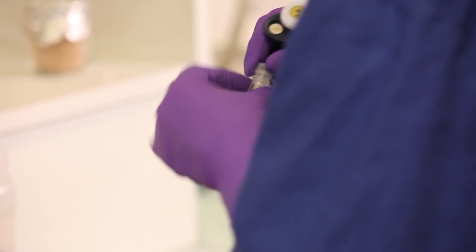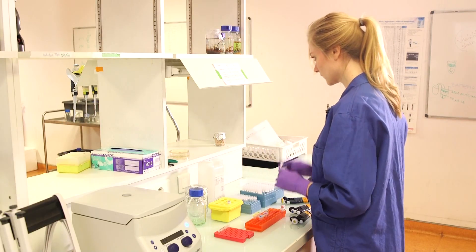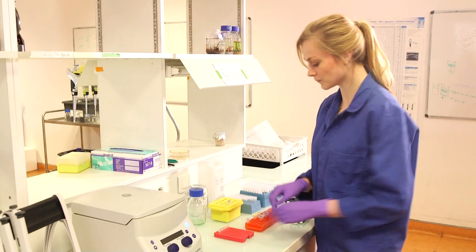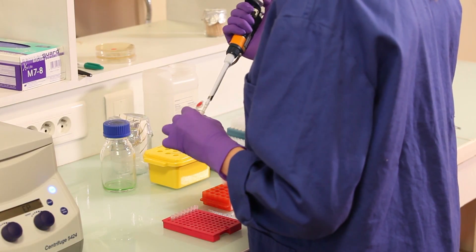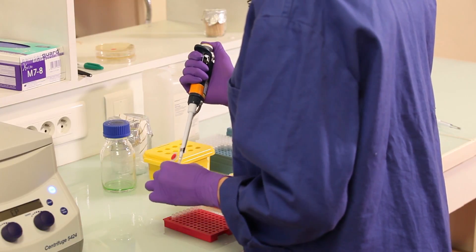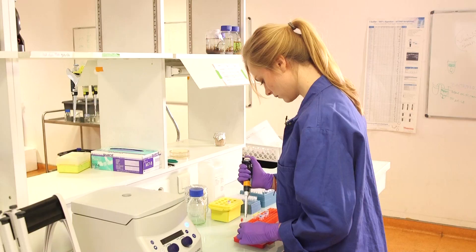So here it is. I have put it on a cool block, which is better for the quality of the enzyme if you want to use it in other reactions as well. So here we have our mix — it contains all the chemicals and enzymes that we need. I'm going to transfer volumes of 50 microliters to these small PCR tubes, mixing a bit with my pipette to make sure the solution is homogeneous. Tubes 1 through 5.